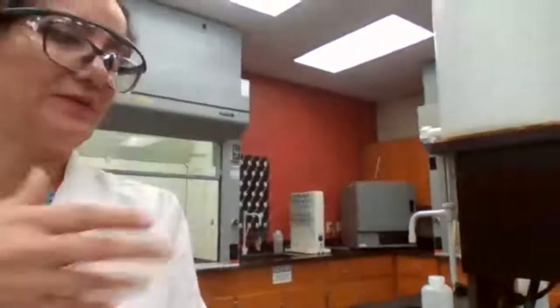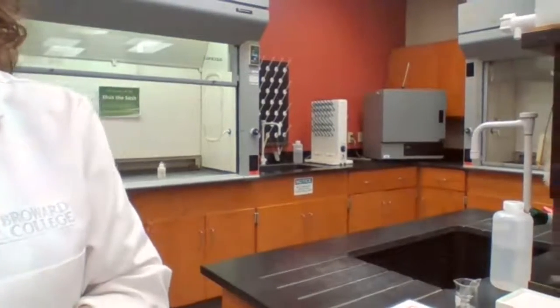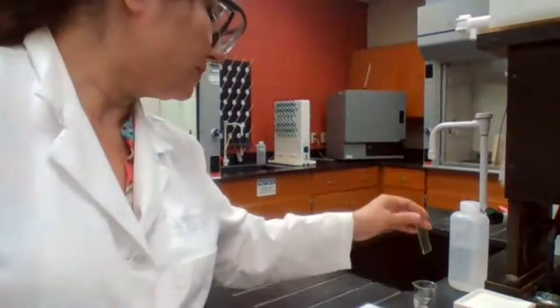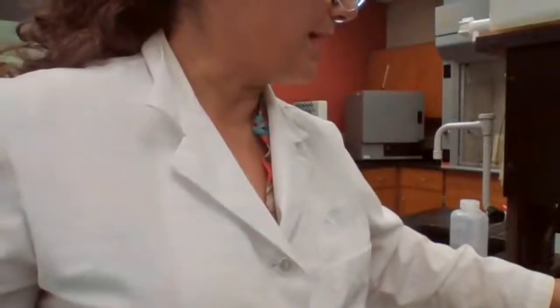Anytime that it requires a number or measurement, you do the measurement, and if it's a number for you to record, then you are going to record it. So, station 1. What's on station 1? It says in this station we have a piece of glass the size of a microscope slide, and we want to measure the mass for you to record the mass.